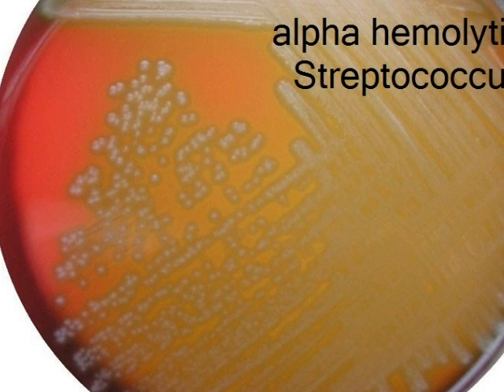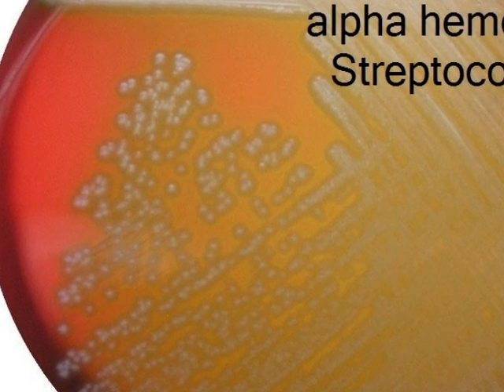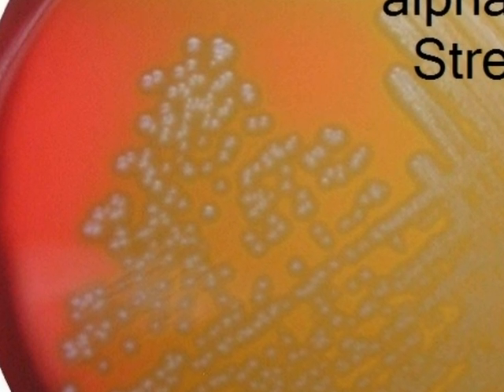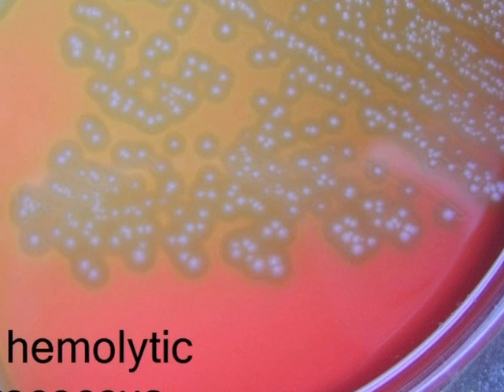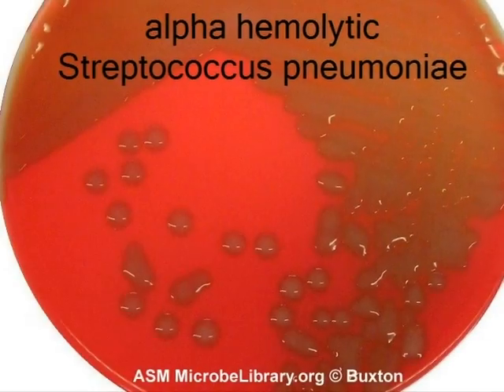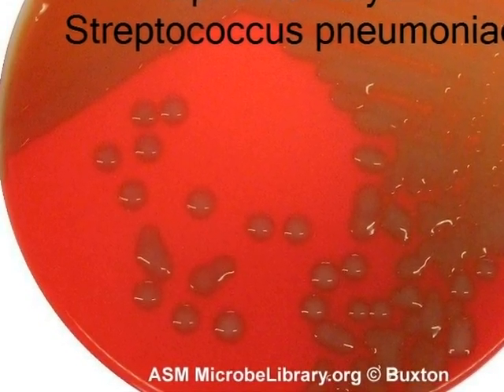When lysis of red blood cells is incomplete, the media will darken or turn green around the colonies. This is referred to as alpha hemolysis. Here we see alpha hemolytic Streptococcus. Here we see alpha hemolytic Streptococcus pneumoniae.